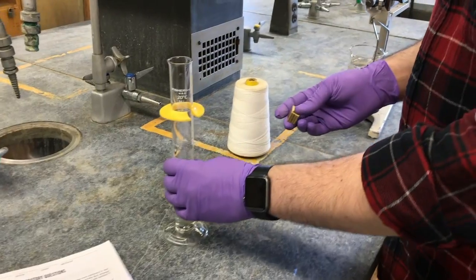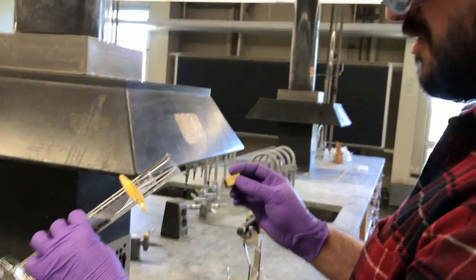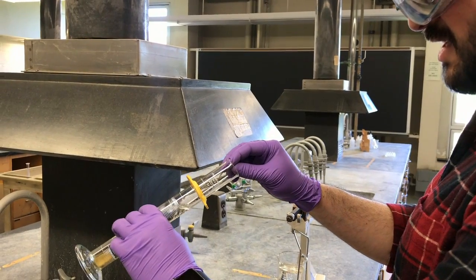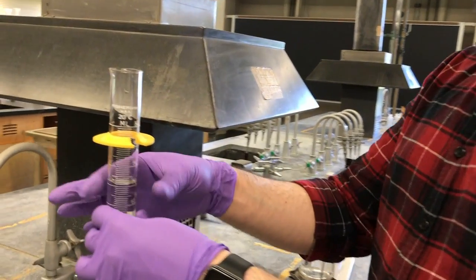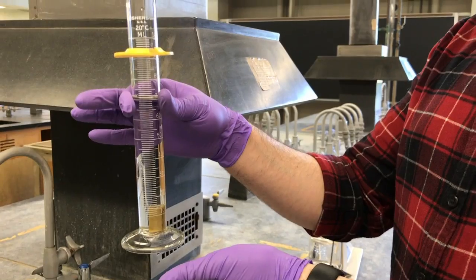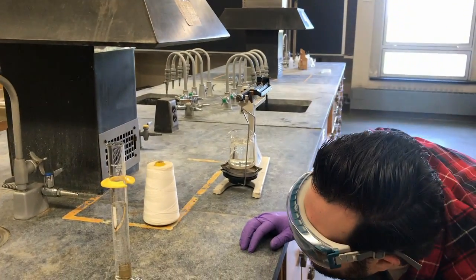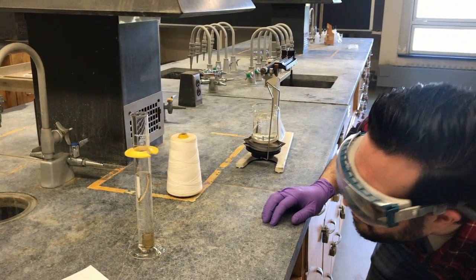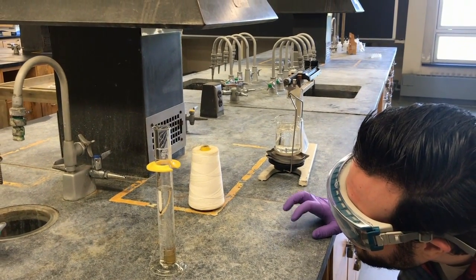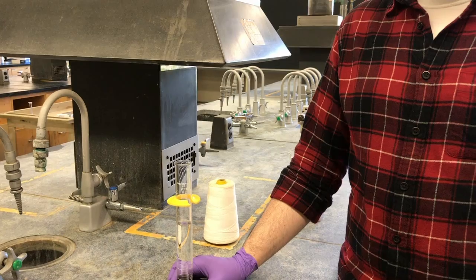And what we're going to do is carefully, tilting it at a 45-degree angle, place the solid here, and you'll want to let it slide towards the bottom. You don't want to drop it directly in, because then it might shatter the bottom, and that won't be fun. So then you'll just record the new volume. That's a good technique, Matt. Flat on the benchtop, bringing your eyes level with it. That's great. So this is 70.5 milliliters. The difference in the volume is the volume of our solid.